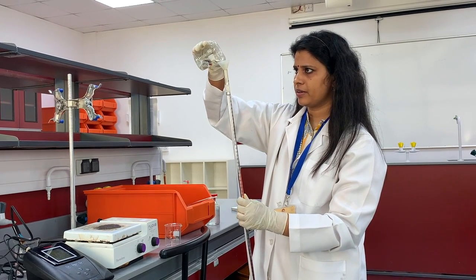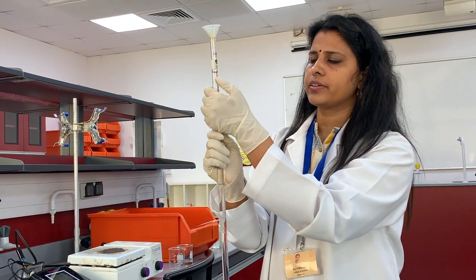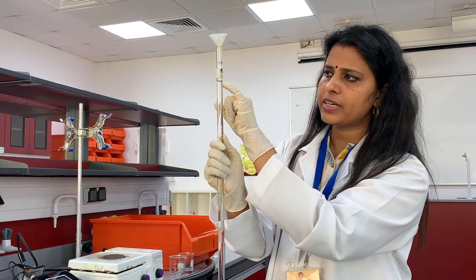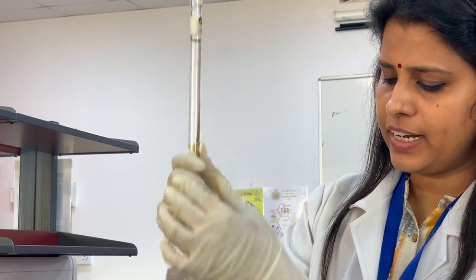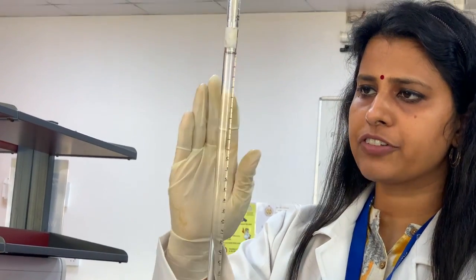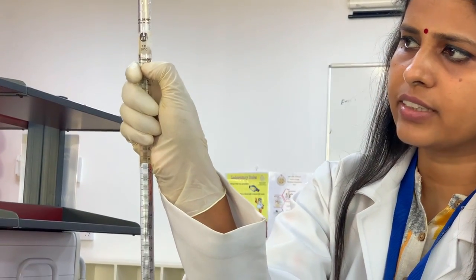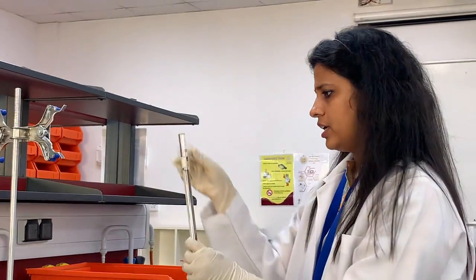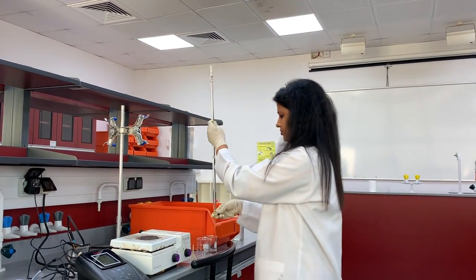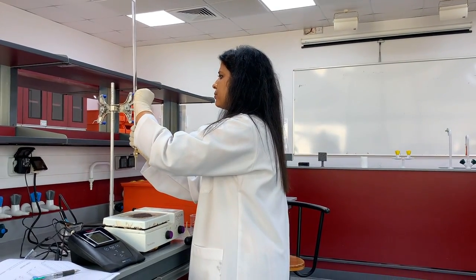This is a 50 ml burette. And see, this solution is a colorless solution. The lower meniscus of this liquid should touch this 0. So, while you are filling this solution in the burette, after filling, you can adjust the volume by keeping it at your eye level. The lower meniscus should touch this line. This is the 0, starting from here, 0 to 50 ml. And clamp it on the burette stand.